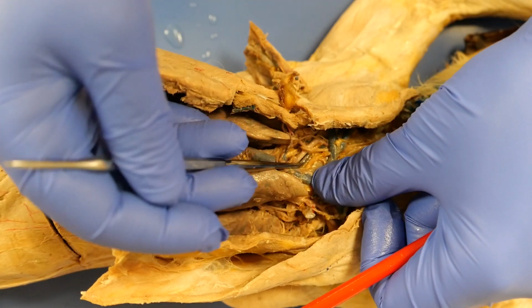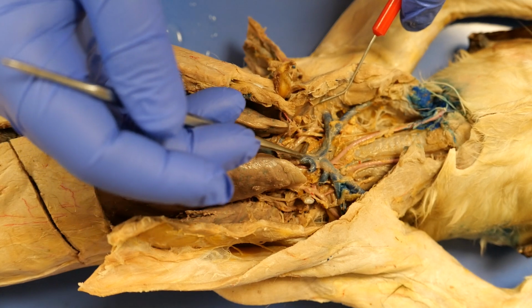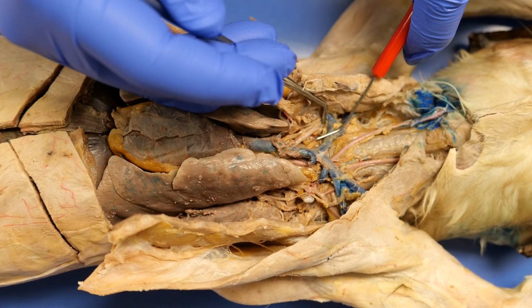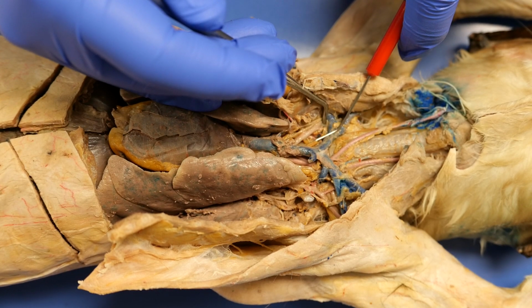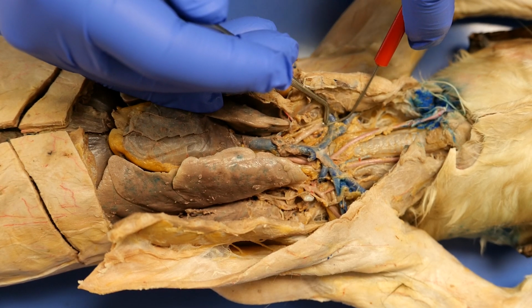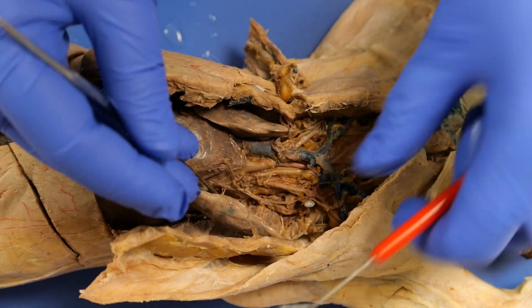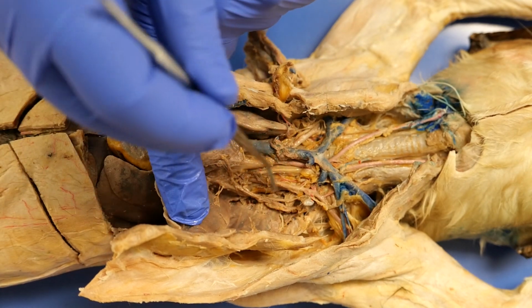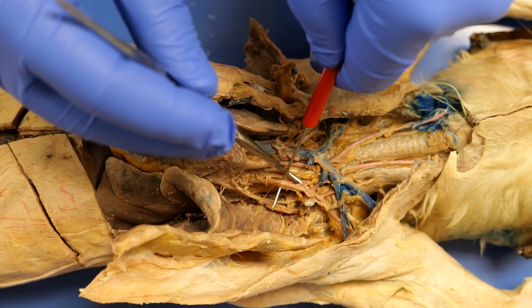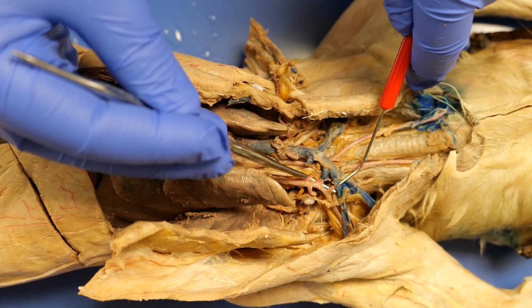I take those three arteries, and then you can see 1, 2, 3. Right there is the first one, the first of the three coming up. That's the vertebral. The next one coming up is going to be the costocervical, and the third one going up is going to be the thyrocervical. If you look over here on the left side, you can lift this up, take this, and you can see vertebral, costocervical, thyrocervical.